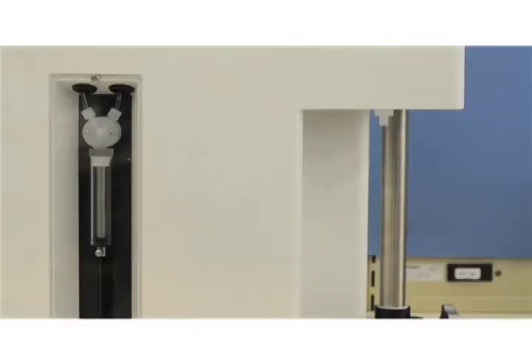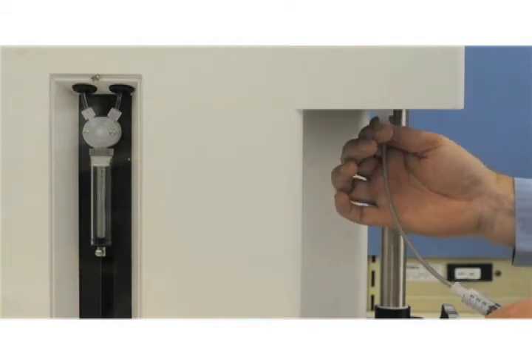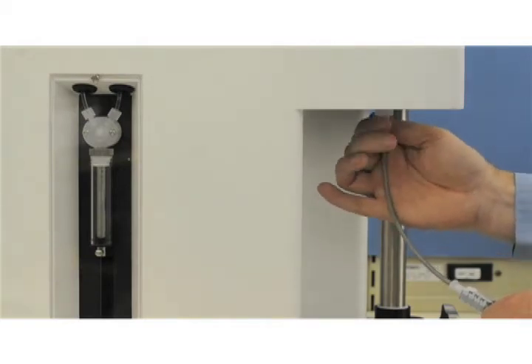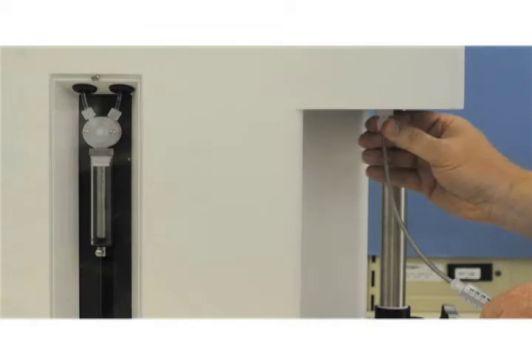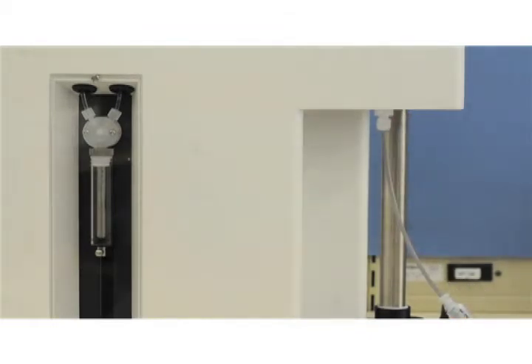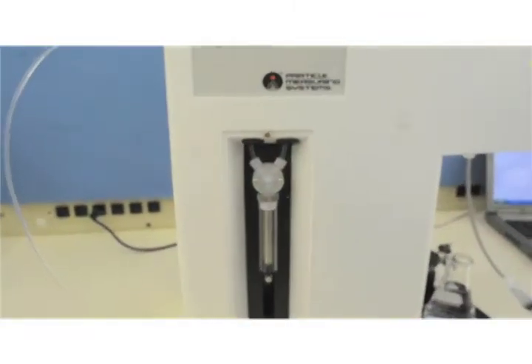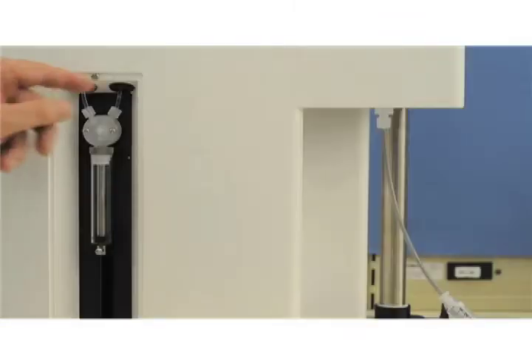Although the order of connection does not matter, we recommend starting with the syringe that will connect to the sample inlet fitting that is located above the sample stage. This will prevent most of the fluid from draining out of the sampler onto your workbench. Remove the splash guard from the front panel to allow access to the syringe connection.